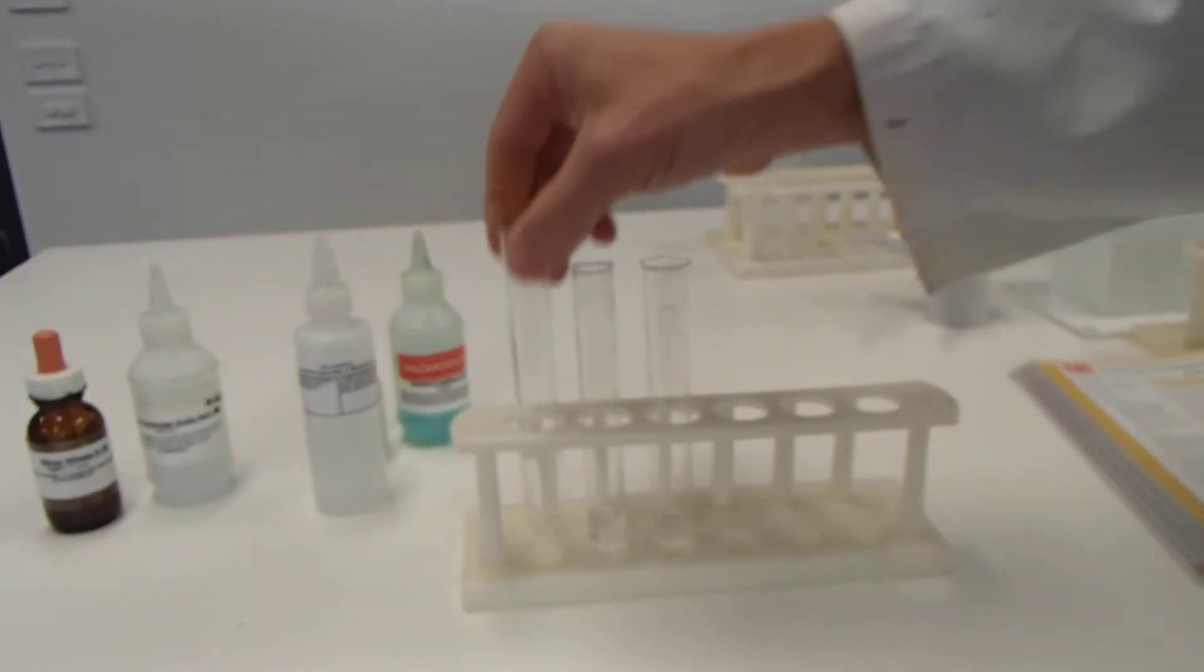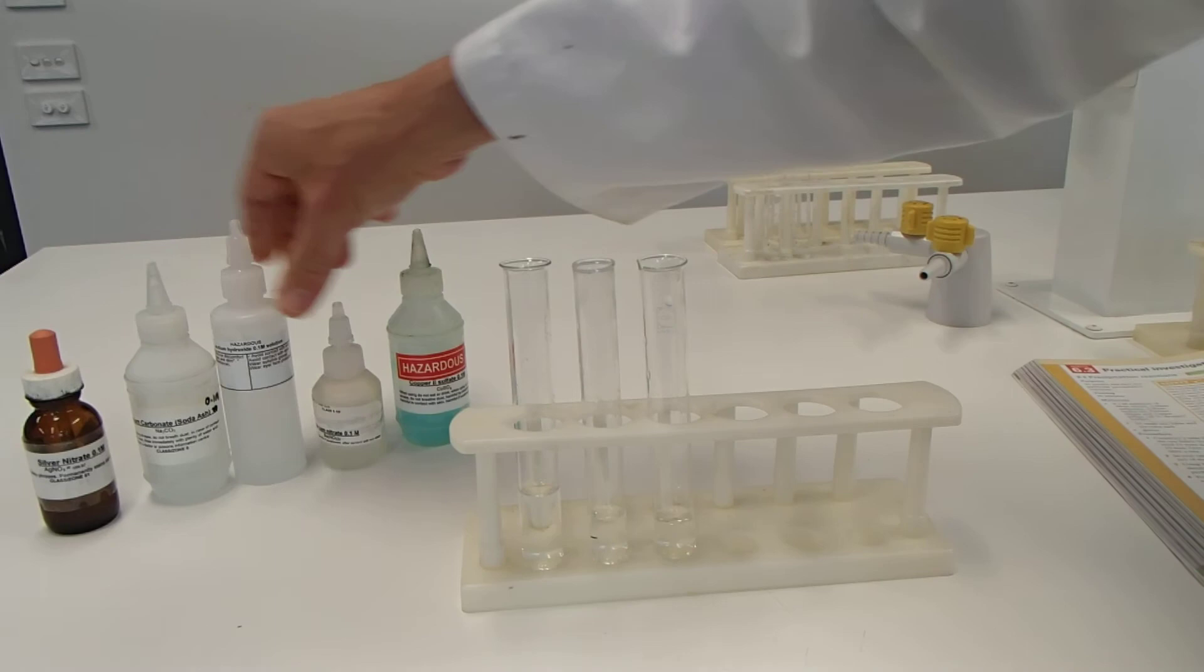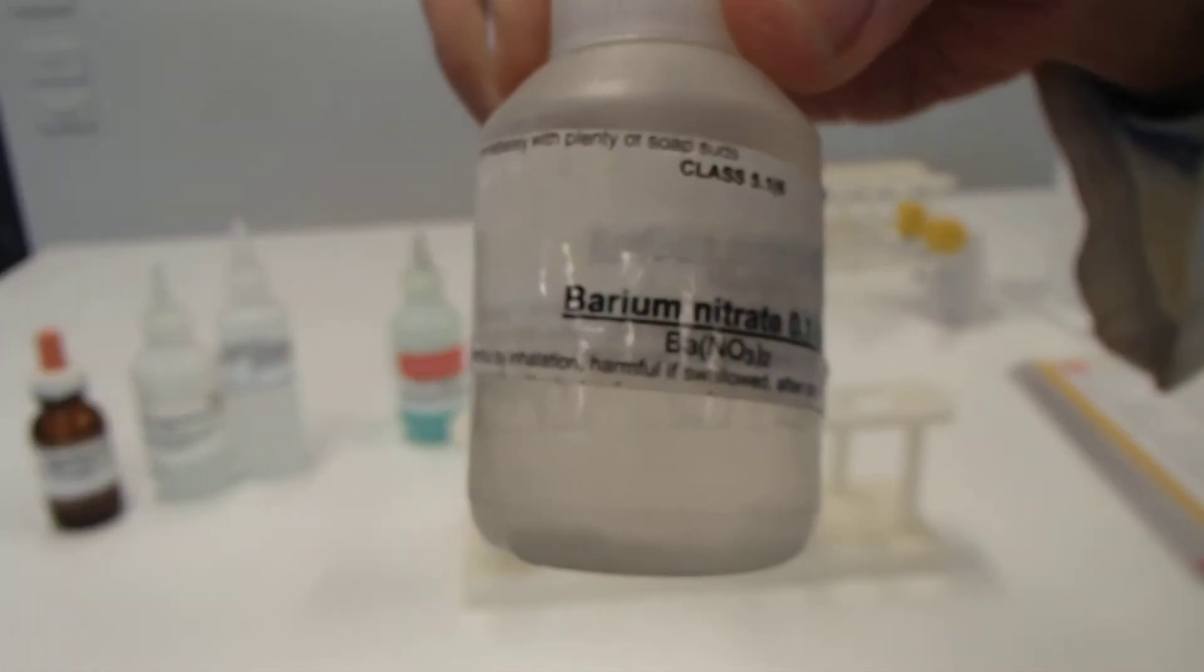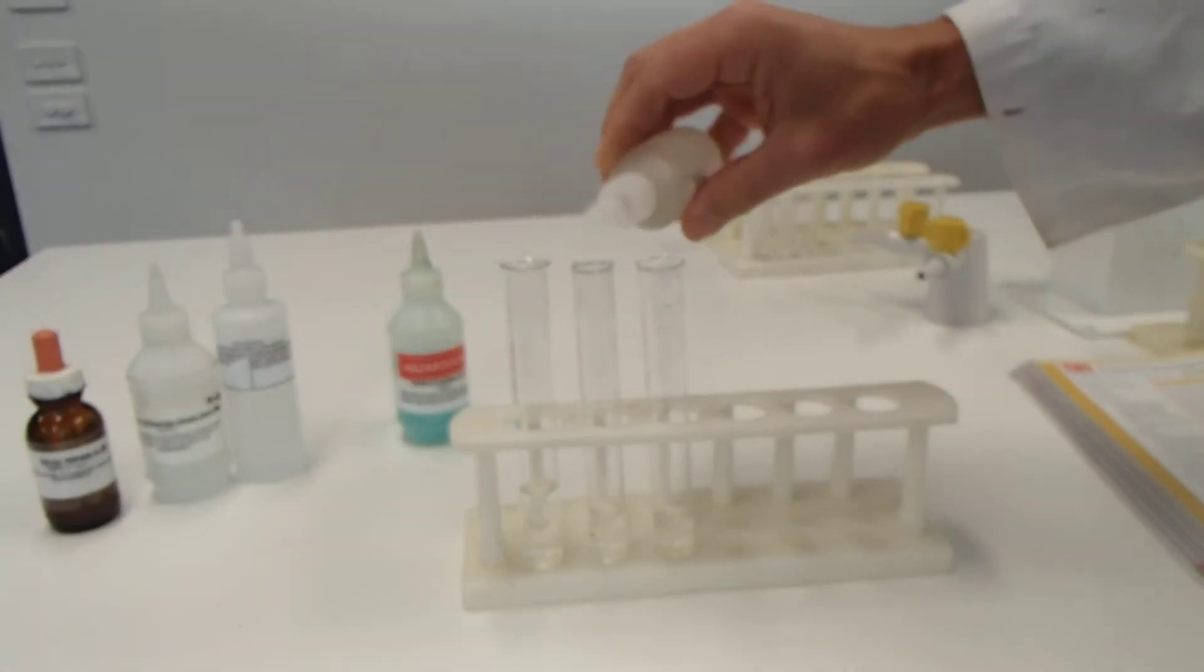Clear. Can't see anything there. Next, we're crossing sodium carbonate with barium nitrate. So sodium carbonate and barium nitrate.